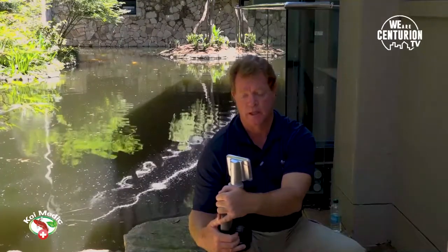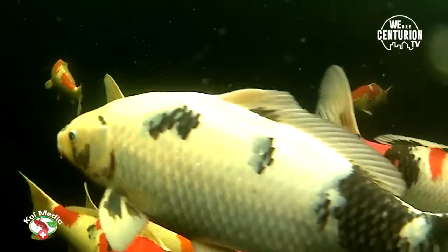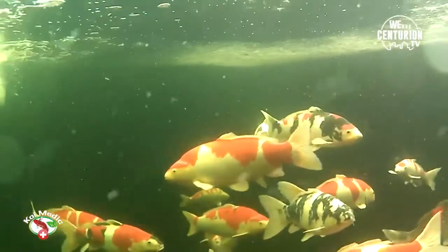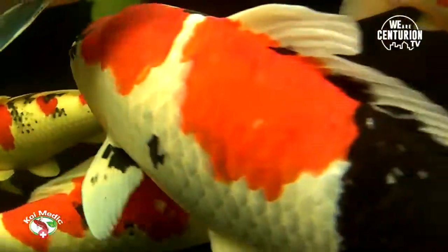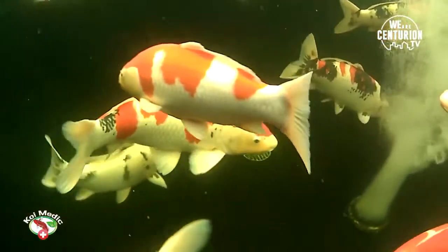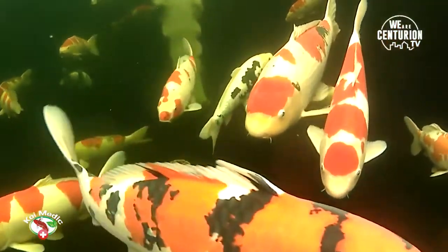If you don't have a microscope, the best option is to call a Koi Medic to come out and assess. If you can get hold of a microscope but don't know what you're looking for, we are just a call away and can help you. Even if you can spot something on your microscope, do a WhatsApp film clip and send it to me — I'll be able to respond and tell you what parasite it is and we can go from there. In that process you learn, and I never stop learning, but I'm happy to help.